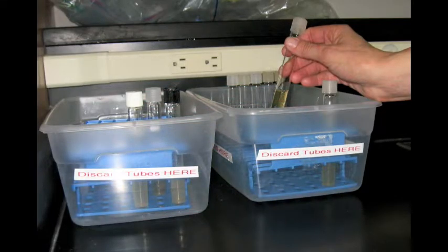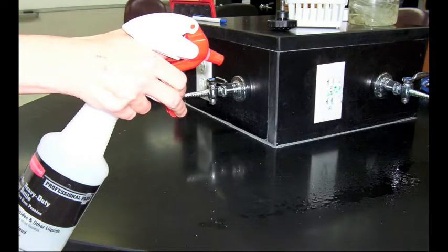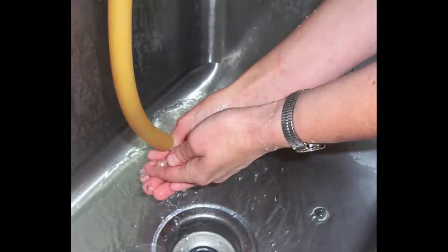Now dispose of the stock culture as directed by your instructor, clean up your area, alcohol your table, and always wash your hands when you're done.